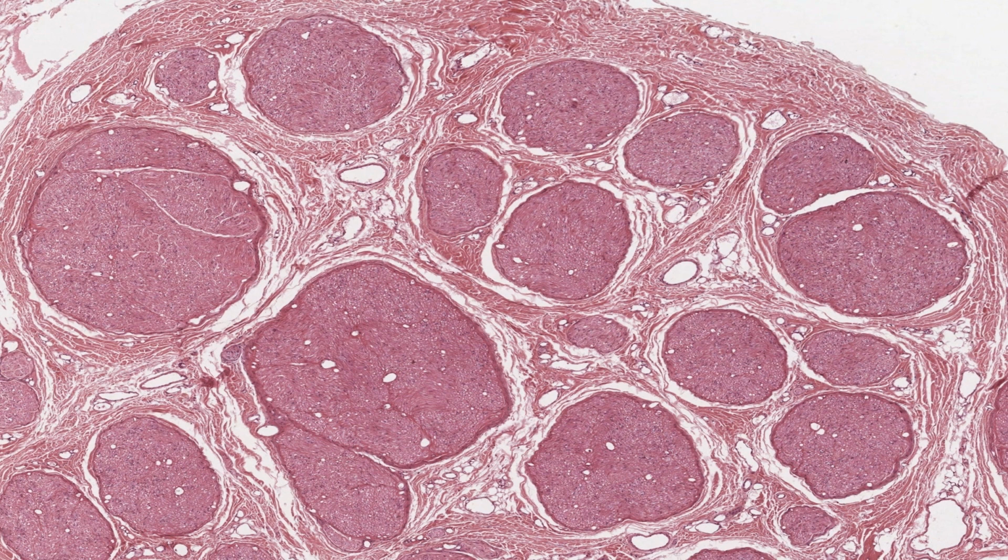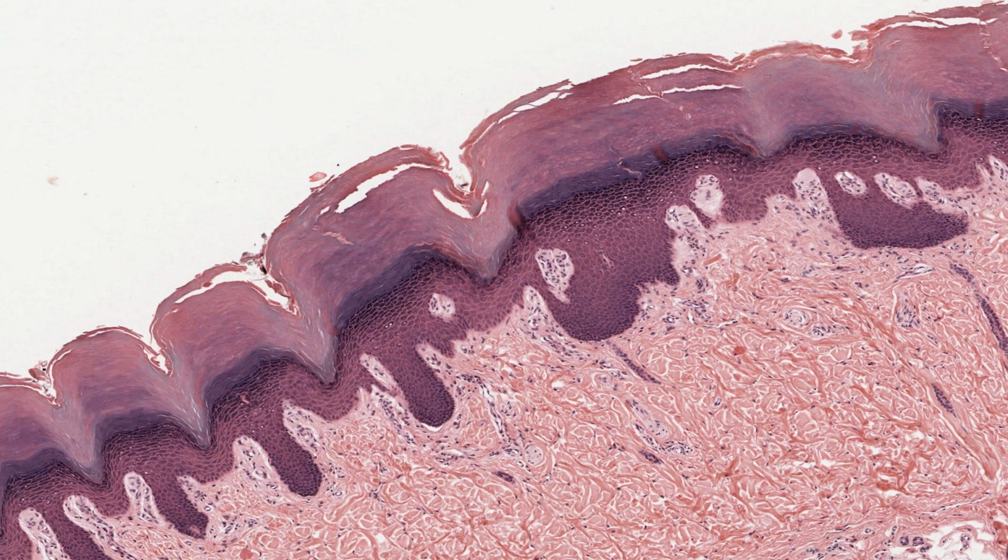Turning to dense connective tissues, a good example of an irregular arrangement is the dermis of skin. It's a very tough layer, resisting injury under many circumstances. For now, look in this image only at the dark red masses of collagen here in the dermis of thick skin. This is a section through your fingertip. Ignore the epidermis, which is in this region along here. In fact, let's look at a higher magnification of the dermis.